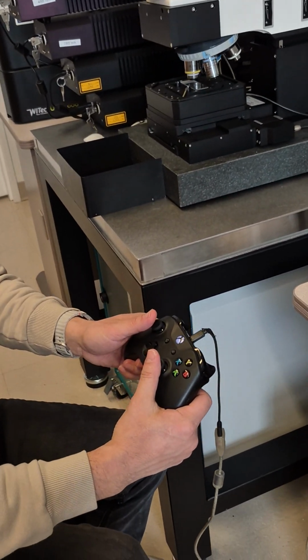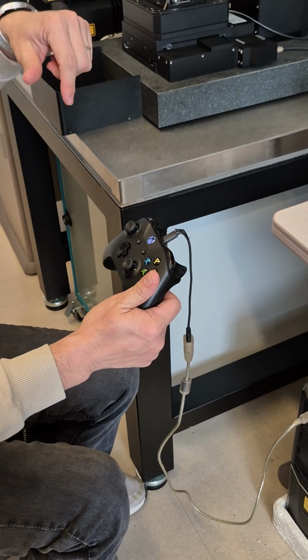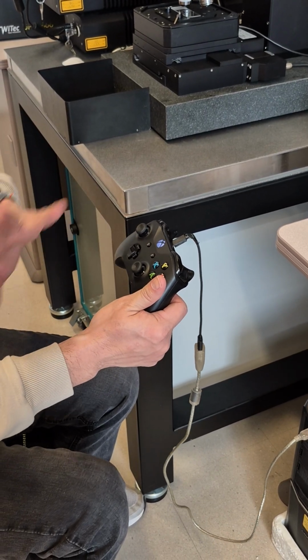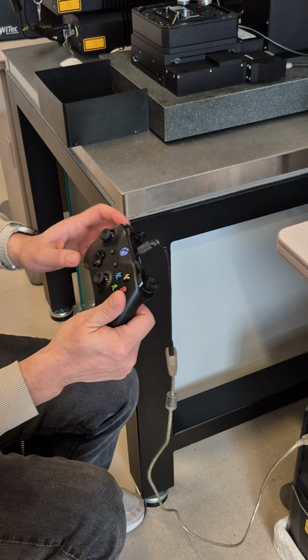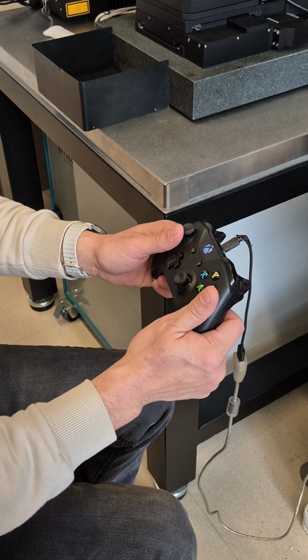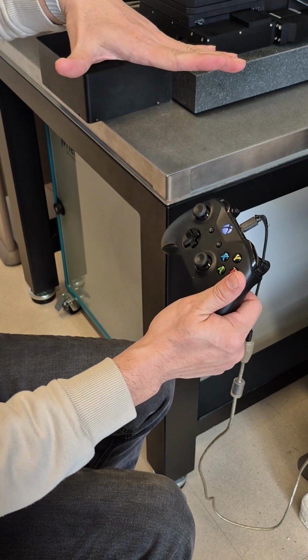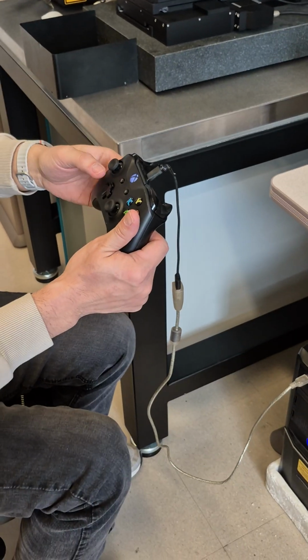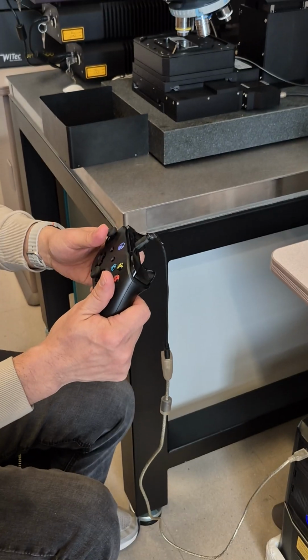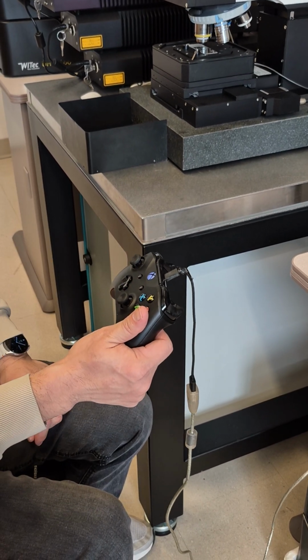These two joysticks: the left one controls the Z, only up and down. If you move left and right, there's no function. It's a single operation. You move up, even if you hold it there, the Z will only move one step up and stop. You must move up, release, move up, release, kind of like step-by-step moving. Same thing moving down.